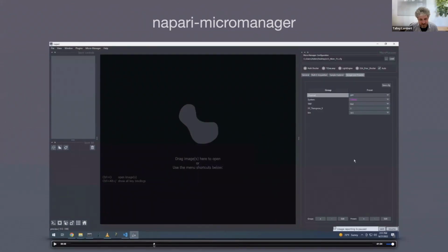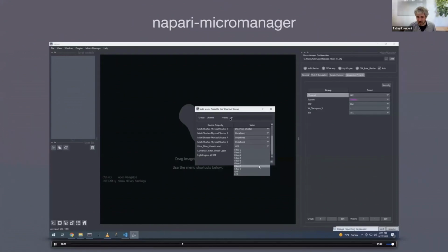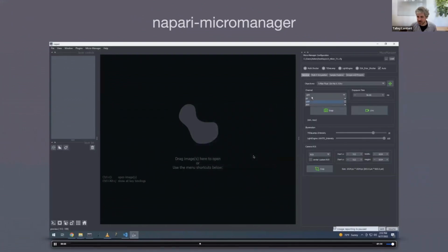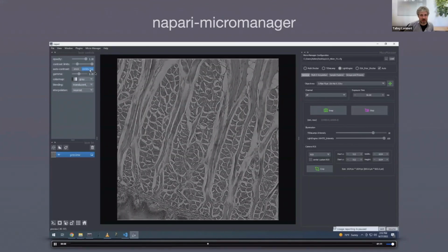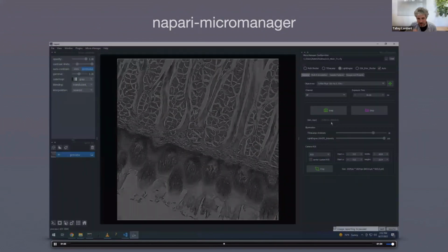Again, if you haven't used Micromanager, it arranges different channel configurations as config groups. So you could say, I have a config group called channel, and in that I'm going to have my dichroic and my emission filters, and for each preset in this group, I want all of those devices arranged in a different configuration. You can add a preset here. These are the various properties that are controlled by this, and on the right is the specific setting of that property for this preset. So Federico here is making a new one called bright field, and he's saying, when I'm in bright field, I want you to be using this filter. This is the same thing you could do in Micromanager, it's just in Python. Then he chooses that channel, goes live, and he can use the layer controls to get continuous auto scaling. And now he's moving the joystick on the microscope, and we're off and running.